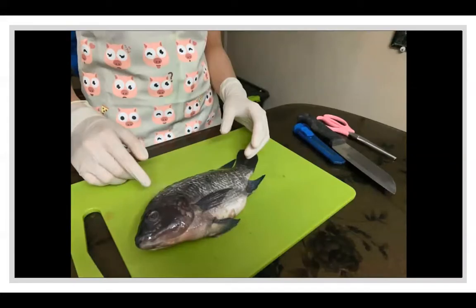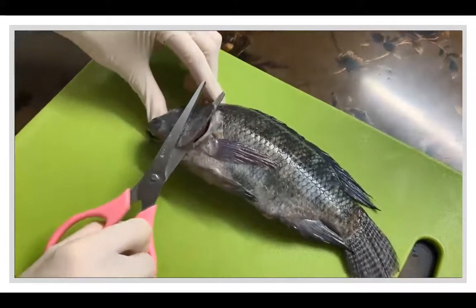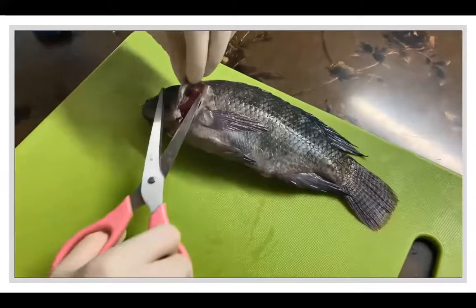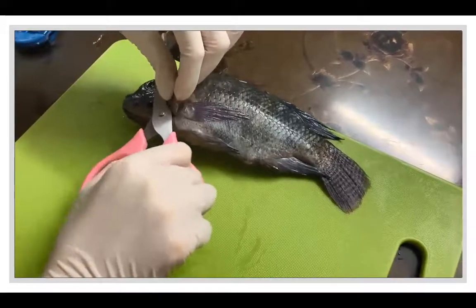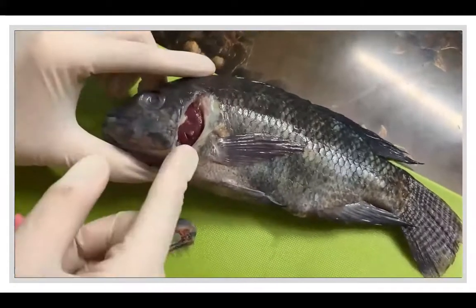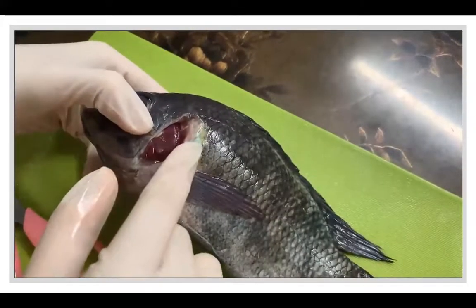Now it's time to dissect our fish to learn its inside anatomy. First, cut the operculum to expose the gills of the fish. These bright red, moist, hair-like structures, or filaments, are the gills. Fish breathe through these instead of lungs.